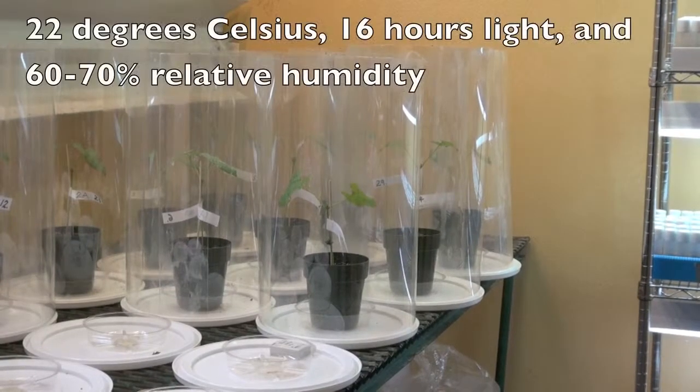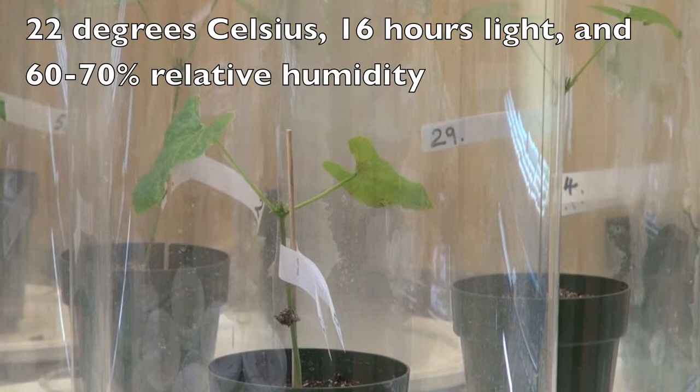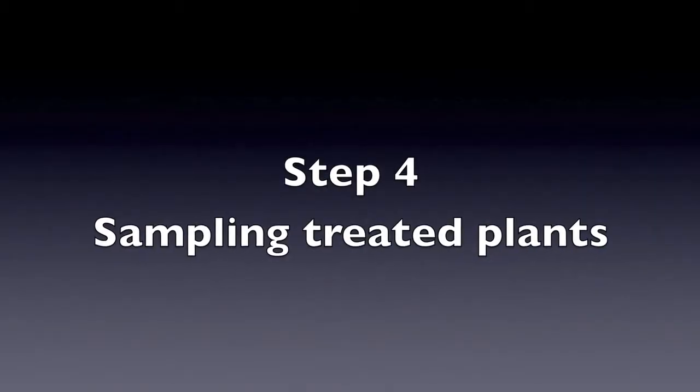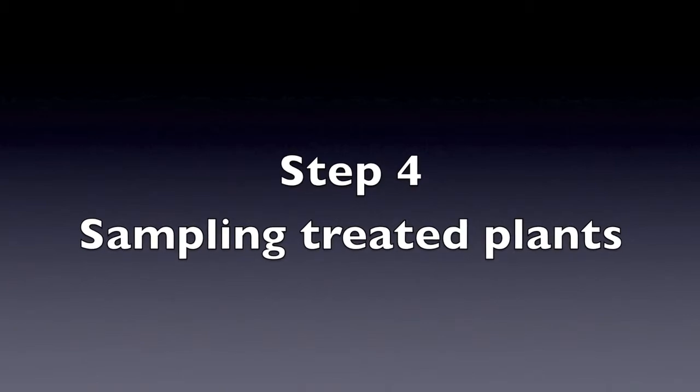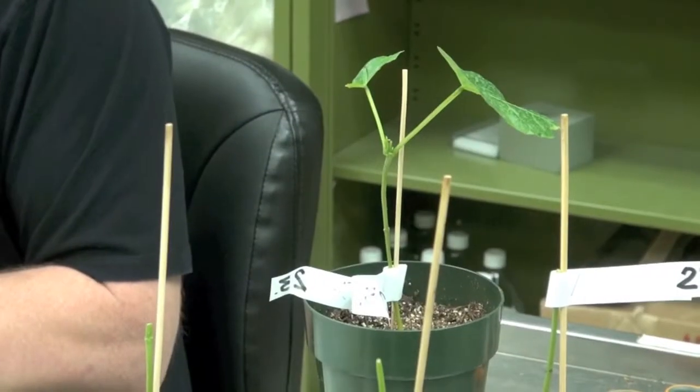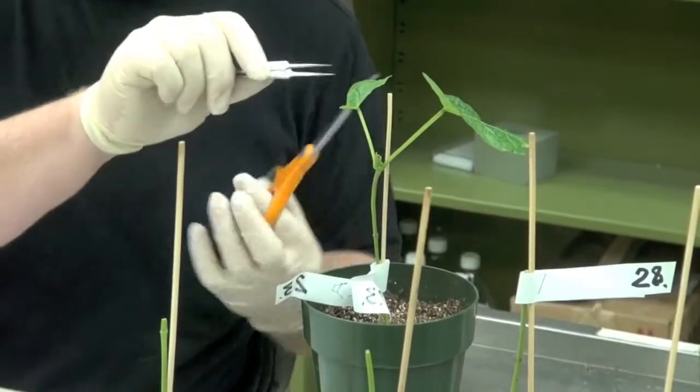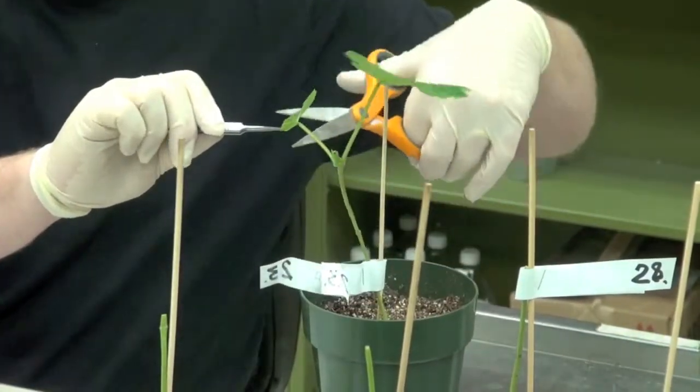The treated plants are then kept in a temperature-controlled chamber until ready for sampling. The Mesocosm plants are destructively sampled 7 days after they are sprayed with the treatments.